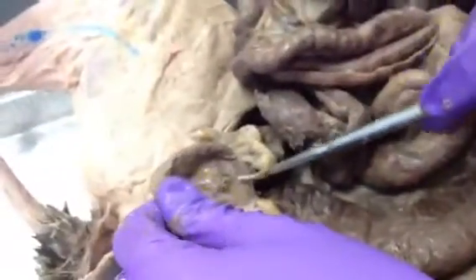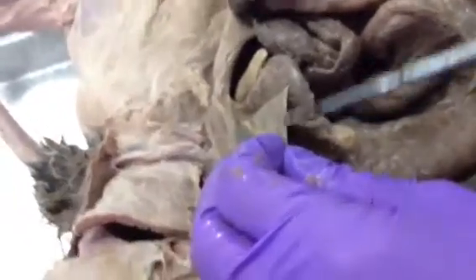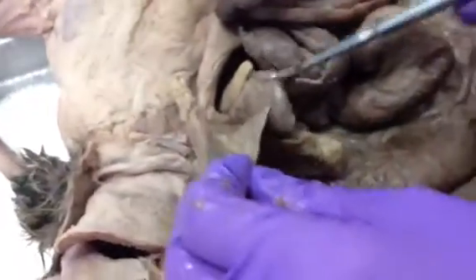And for the urinary system, it goes to the kidneys and down, and then the urinary bladder is here. The median vesicle ligament is here. If the end is rounded, like it is here, you call it the round ligament of the urinary bladder. The lateral vesicle ligaments are embedded in this fat, and they suspend the lateral sides of it.